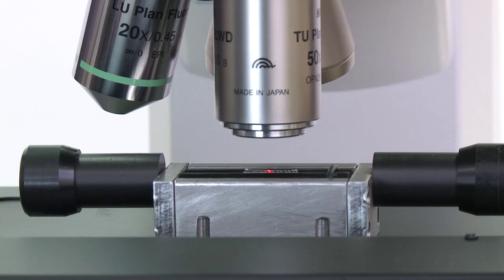In this example, I've got the n-gauge focused on a cardiac stent. Inside the n-gauge there are in fact two optical systems. There is a white light imaging system which enables you to inspect the surface of the sample just as you would with an ordinary optical microscope, and also the laser interferometry system which makes the measurement.